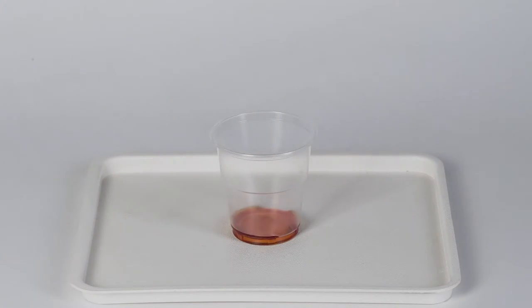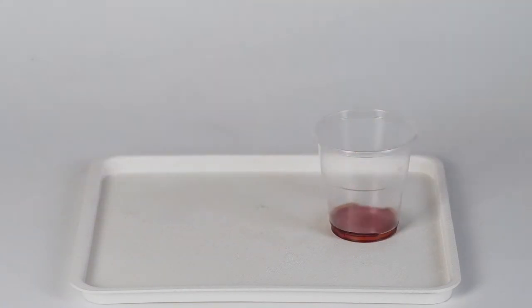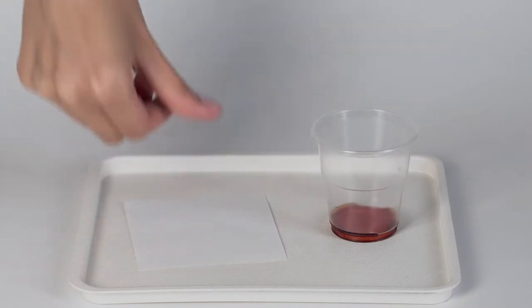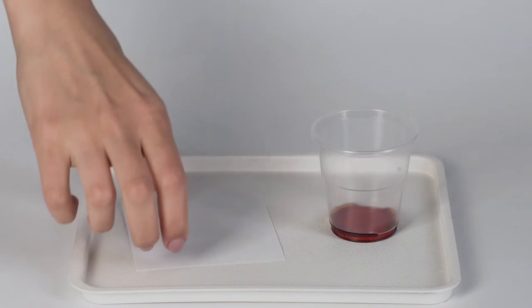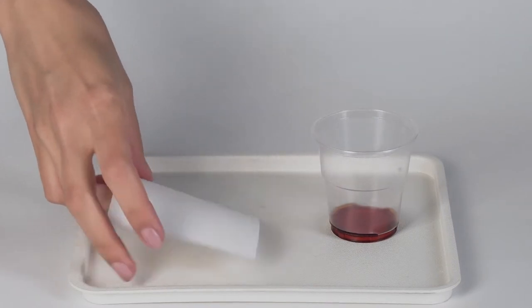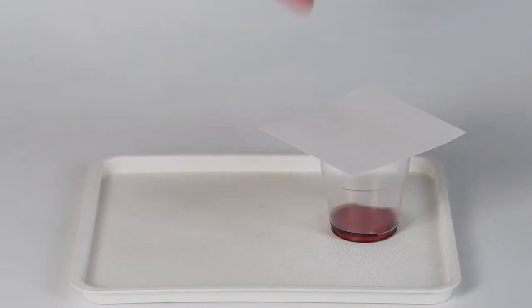Now take off one of the protective gloves and make a fingerprint on the white sheet of paper. Cover the cup with the sheet so that the fingerprint is facing down and wait for 5 minutes.